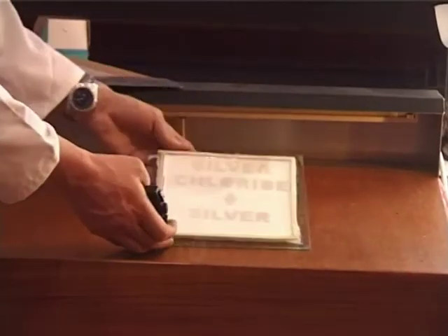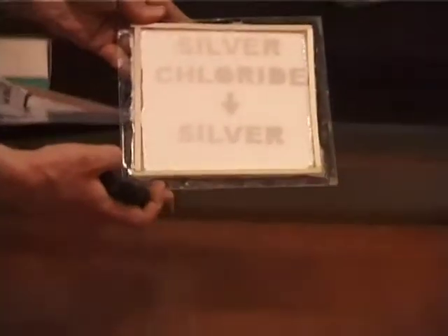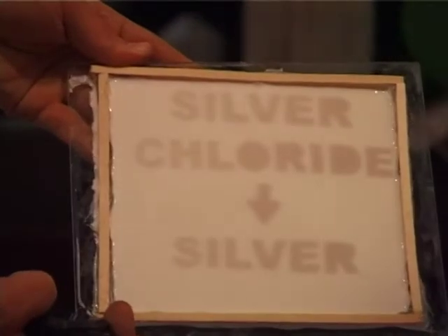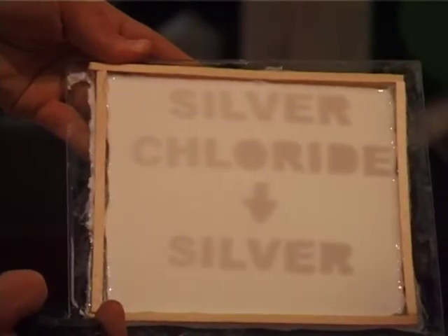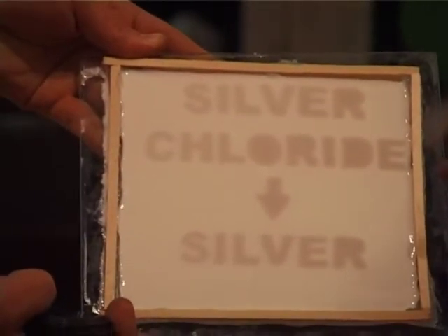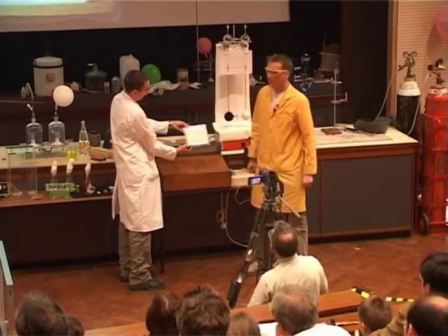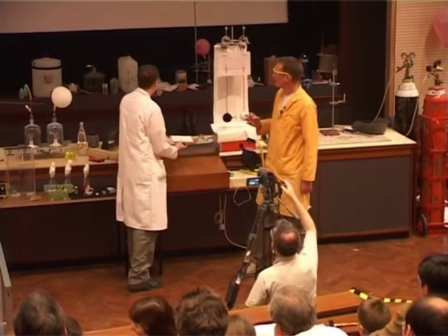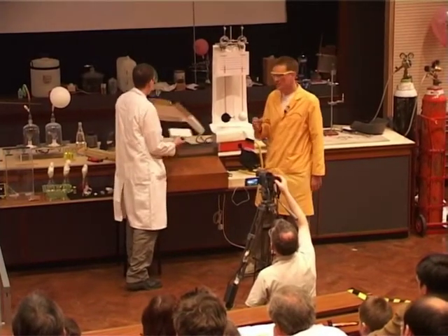And if we hold this up, we should be able to see here — there we are — silver chloride going to silver. And this reaction is brought about by the light energy.